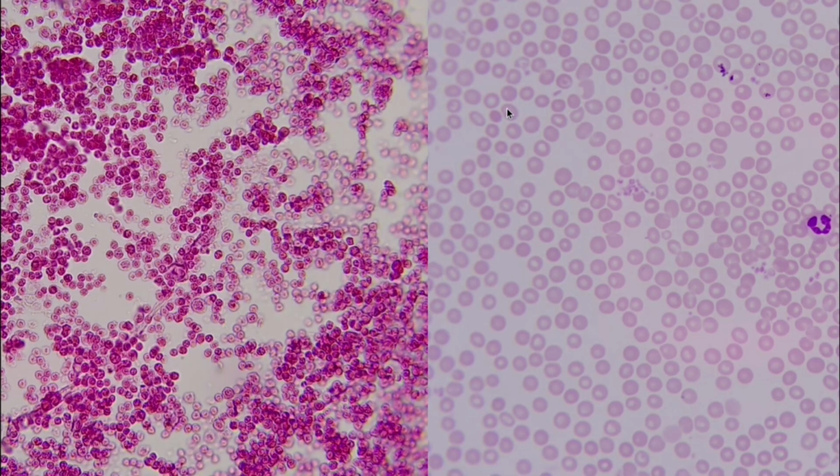Whereas on the reticular tissue side, first of all, we can see these fibers stringing through, right? We can still see those a little bit. And then these cells have a lot going on inside of them, right? They're not empty, they have a whole party going on. And where it might get confusing is you can see these things running around here like little platelets or different types of cells within the blood, but what we're really looking at is, is there something inside of it? If so, reticular tissue. If not, you might be looking at blood.